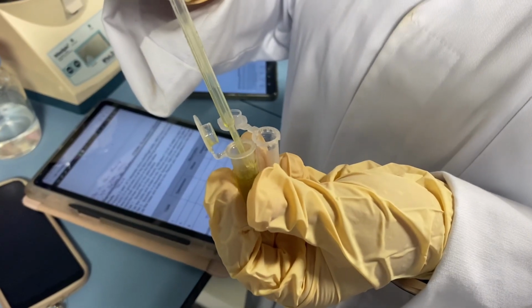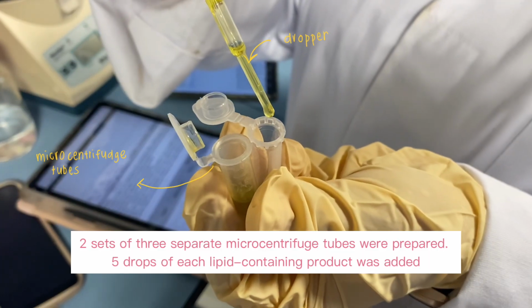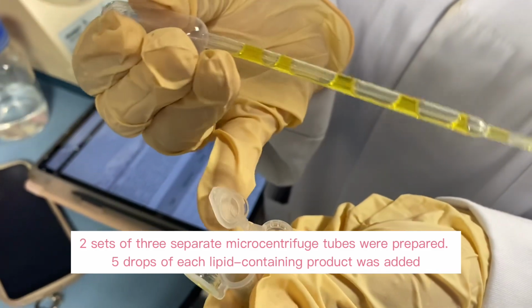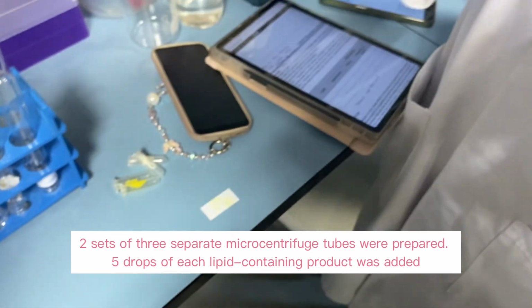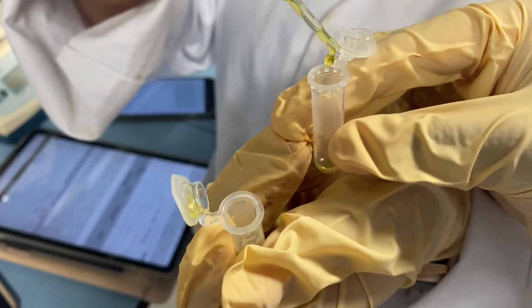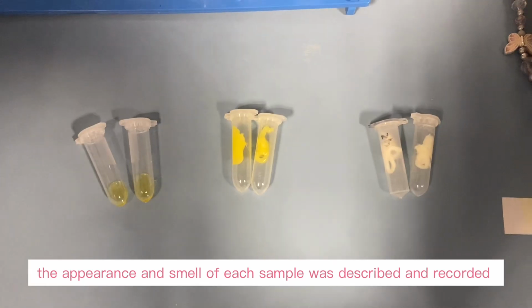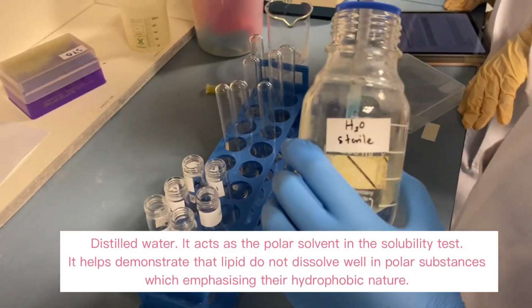Alright, as we can see here, we use 2 kinds of material, which is microcentrifuge tubes and also dropper. So the function of microcentrifuge tubes is to hold small amounts of lipid-containing food samples and solvents. For the dropper, we use it to dispense small controlled drops of liquid lipid samples and also solvents. Based on the methodology, we have to put 5 drops of each lipid-containing product into the tubes.